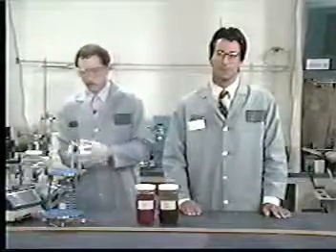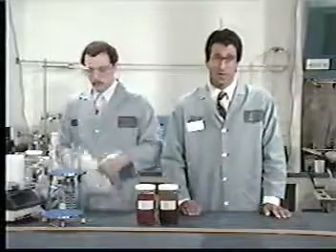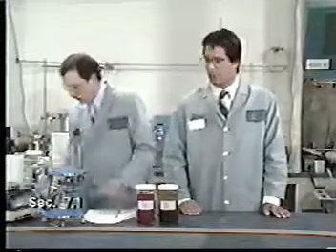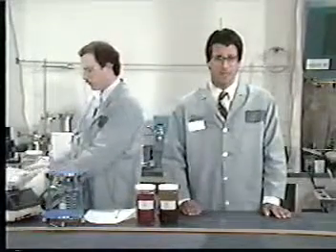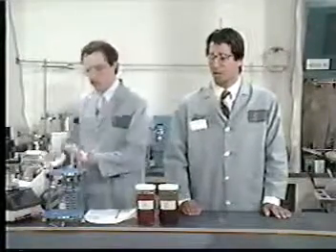Collect and test at least 2 samples of the waste, 3 if volatiles are of concern. We are ready to begin the TCLP preliminary determinations. For this purpose, the first of 3 samples of the waste will be used, a minimum of 100 grams. Bill will start by evaluating the percent solids of the waste. This is defined as that fraction of the total waste sample from which no liquid may be forced out by an applied pressure, as we will see.